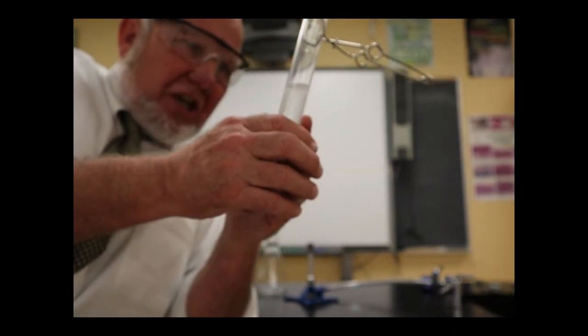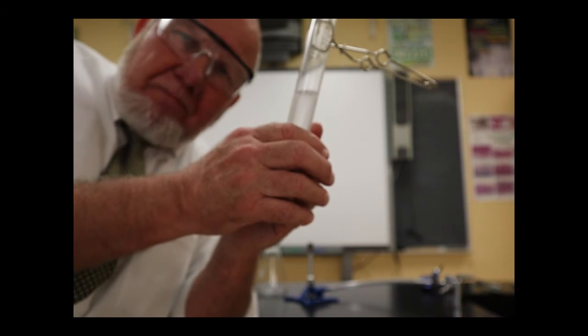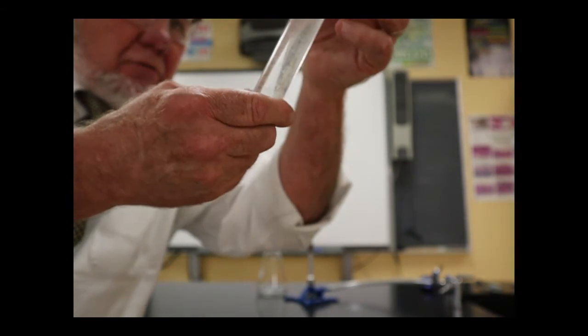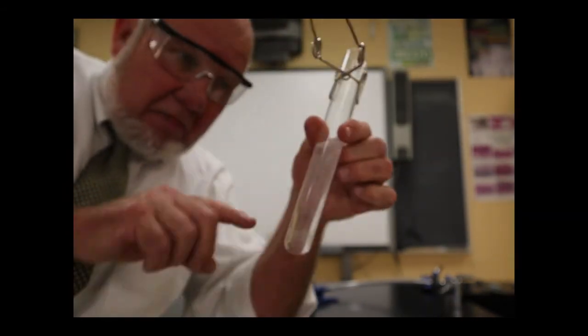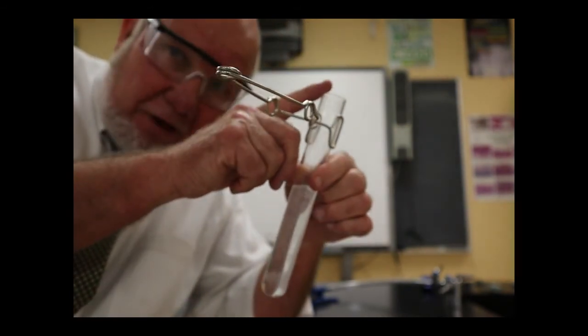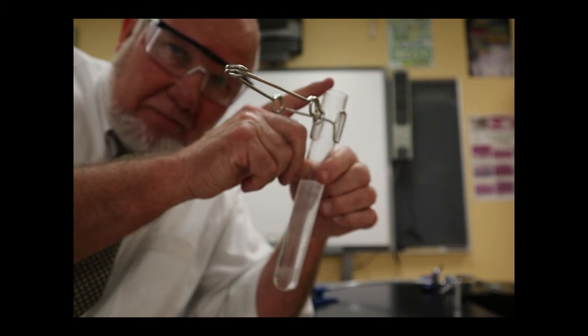Well, possible change of plans here. Now I think we're going to evaporate it. I don't feel really great about the fact that the test tube is about half full, and I want to evaporate this off. You'll kind of see the problem. I want to boil the water off, but I don't want any to come out the top. That's where I'm going to have to be really careful. It's going to be kind of tricky.